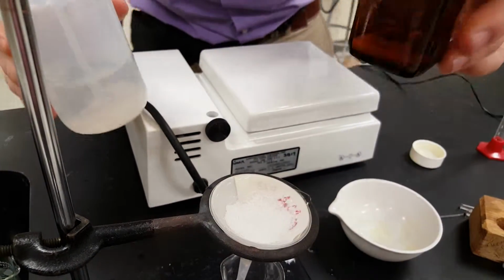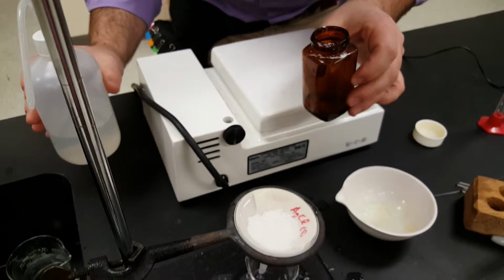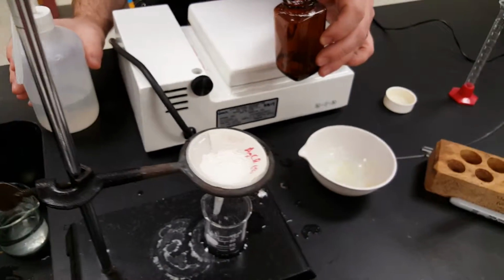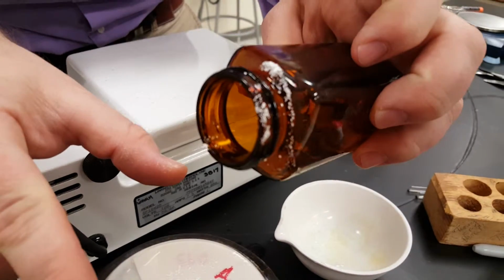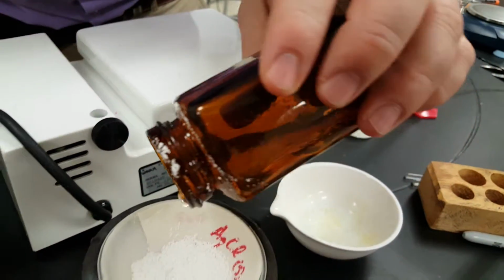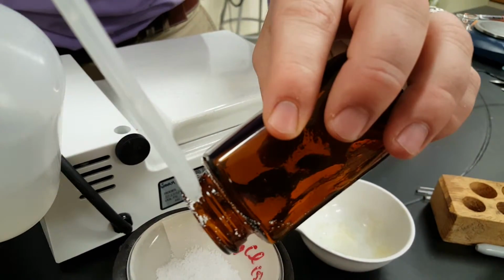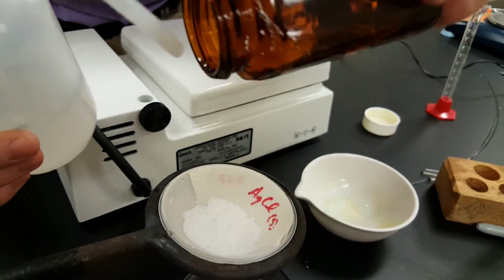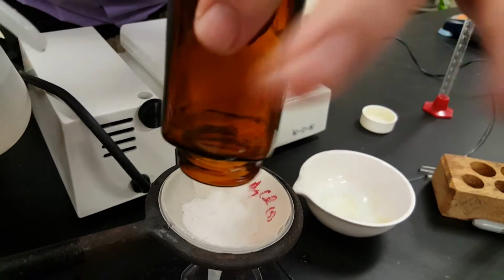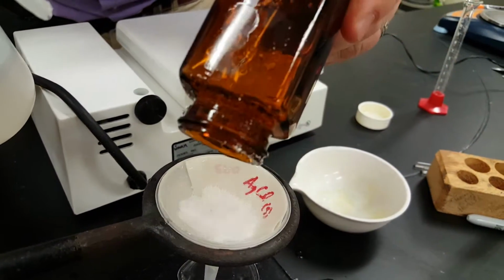Now I can guarantee you, slow down. Whoa, overflow. Should have used a bigger filter. Now look here, we're going to have some waste. We're going to lose some chemical. So of that 2.5 grams I was supposed to make, maybe we'll make a little less, like 2.3 or 2. And it's tough to see, but there's still some stuck on the inside of the bottle.